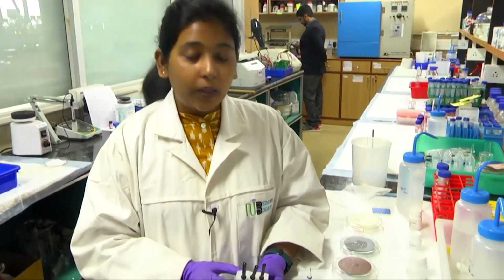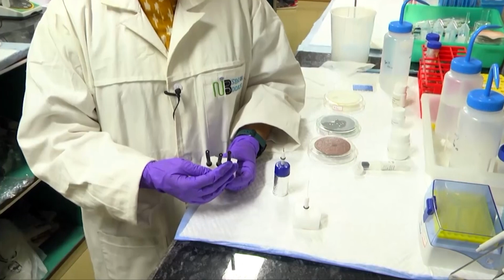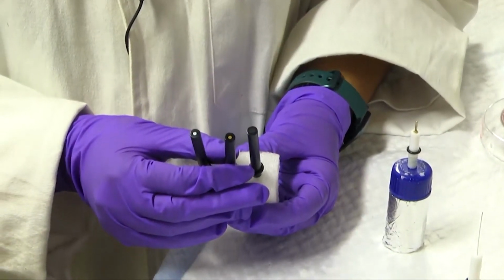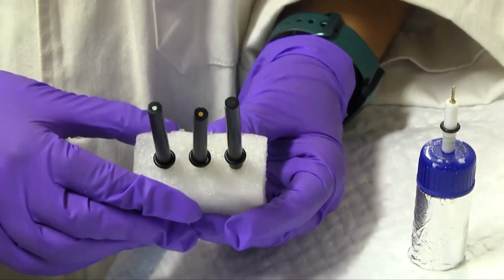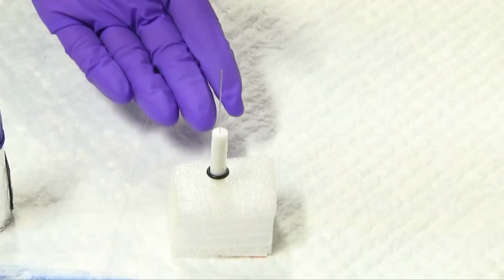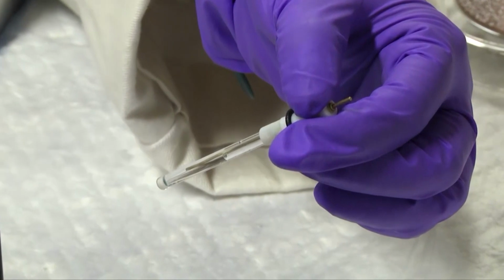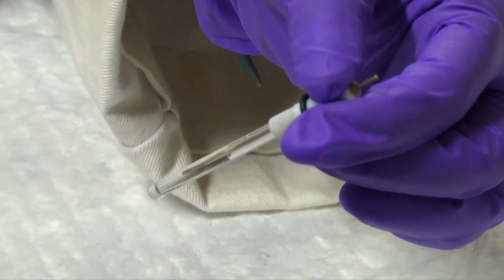So this is the working electrode. We have 3 types of disc working electrodes here. This one is a glassy carbon. We see the glassy type shining here, that's why it is called glassy. And then this one is the gold electrode, followed by the third one, which is a platinum electrode. So these are the 3 working electrodes. Now this one is the platinum counter electrode. The thin wire is the platinum. Now for the reference purpose, we use the Ag/AgCl reference electrode, which is dipped in 3 molar KCl.